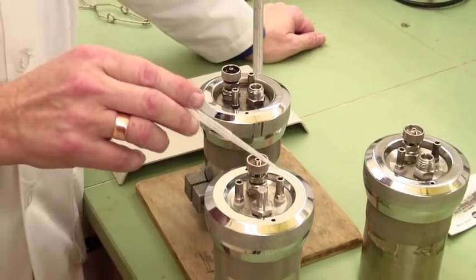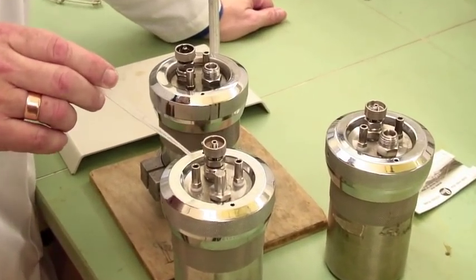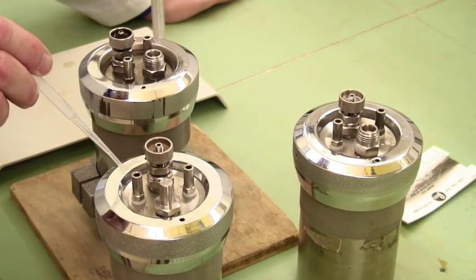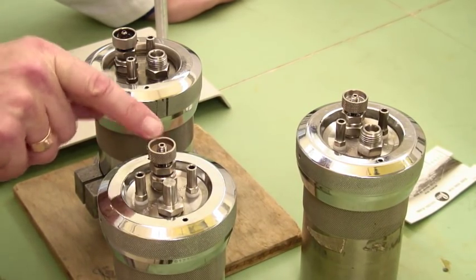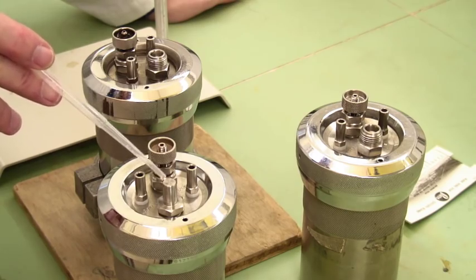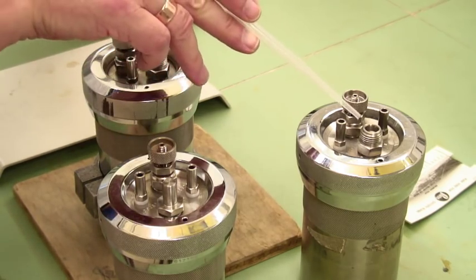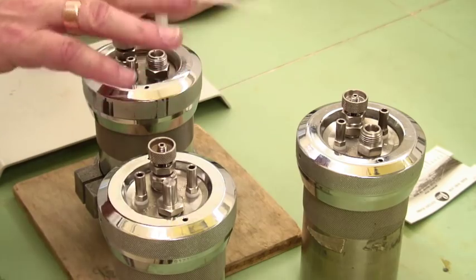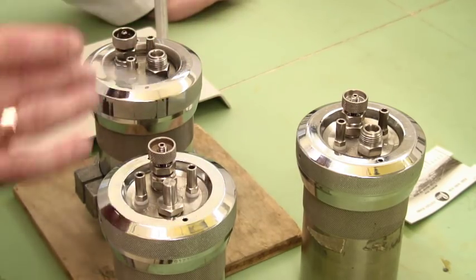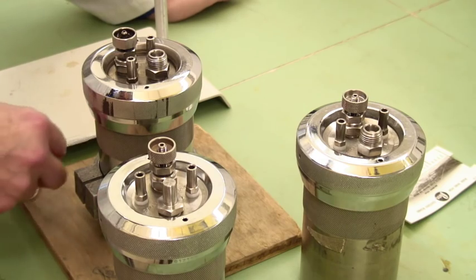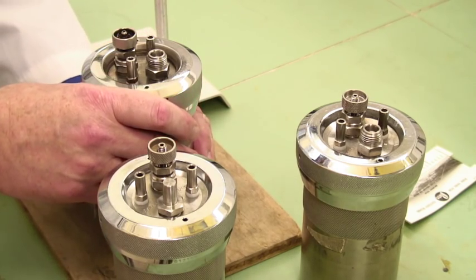Let me look at these two bombs that we're not actually using. There are four attachments on this one. These two are the electrodes that you will actually be using to fire the bomb itself. This is the release knob, so you open and close this to let gas out at the end. And this is the charging input. If you look at the two of them, these are slightly different. This is the older one. It has a threaded input. This one has a sliding straight input. So we have two separate chargers depending on which bomb head we have. This one here has a threaded attachment, so we'll be using that particular oxygen cylinder.